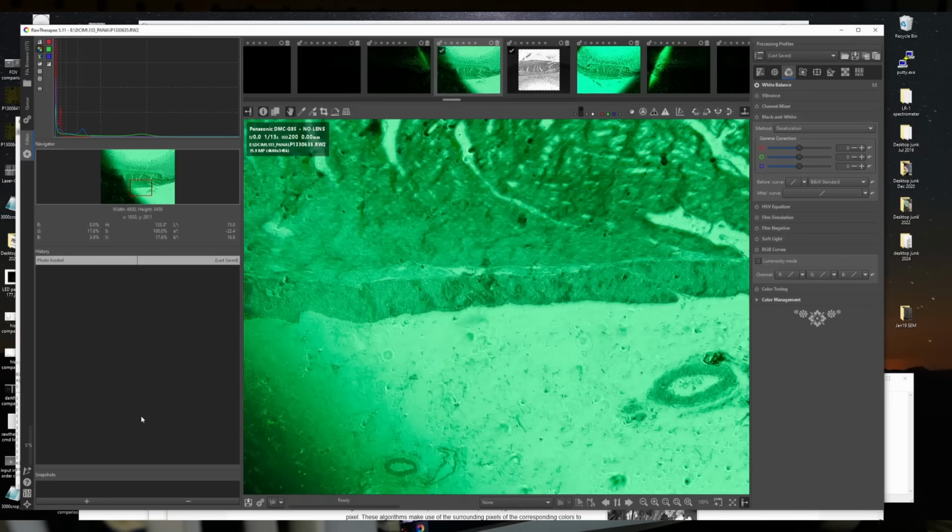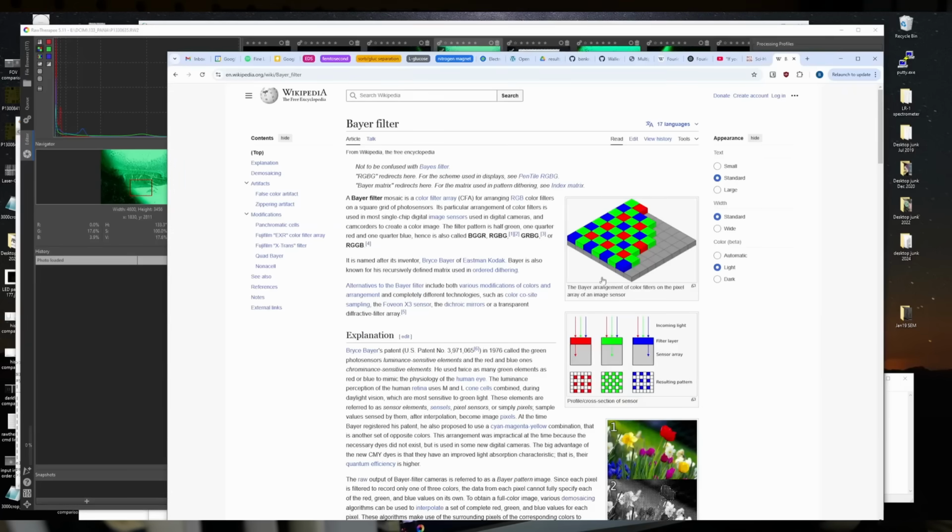So we've got a whole bunch of images from the digital camera, and they're all raw. We can't shoot in JPEG because the compression would destroy this whole technique. And again, if you want to try this, don't do what I did, because collecting images from a modern DSLR camera that's color makes this not work, and I'll show you why. The modern color cameras have this color filter over the image sensor, and so we're going to illuminate the scene with a monochromatic LED. Let's just say red LEDs.